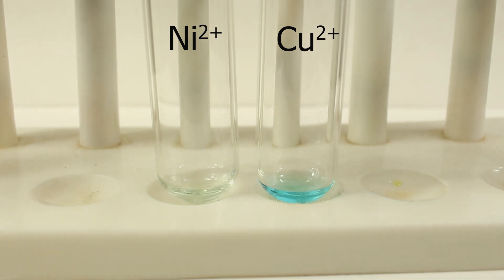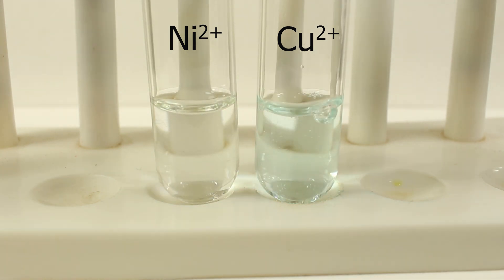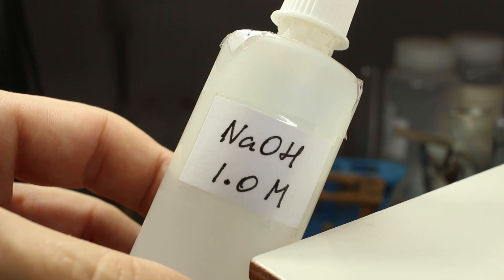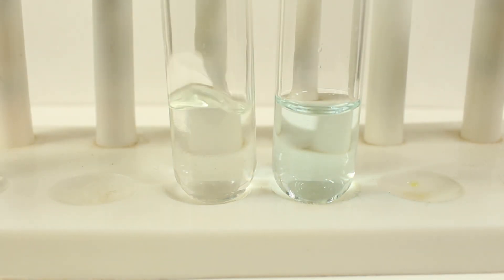Here we use copper sulfate for testing and nickel sulfate as a control. Let's see what happens on addition of sodium hydroxide.